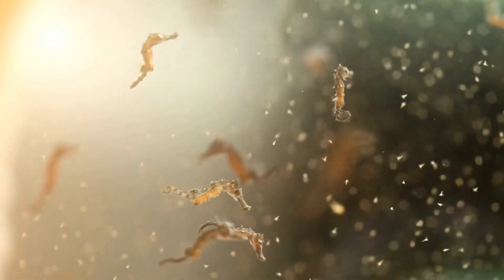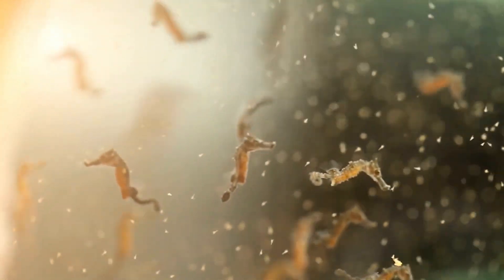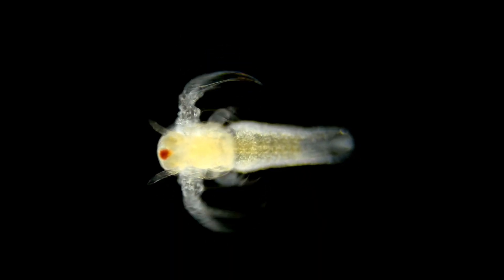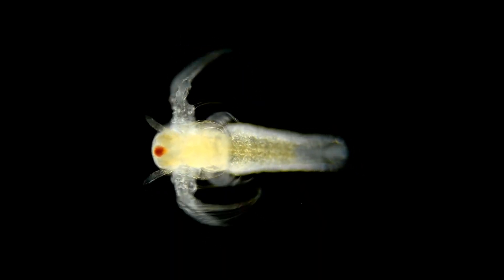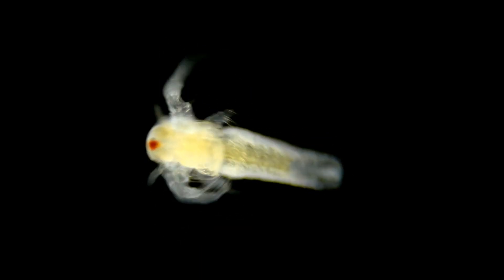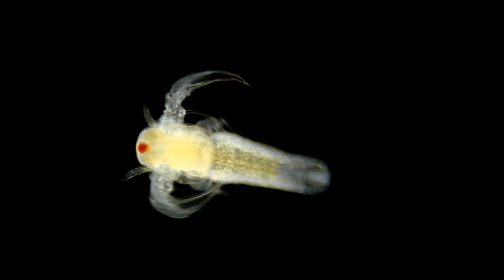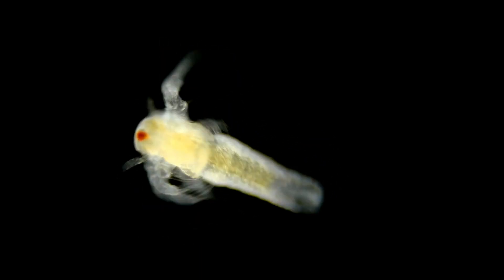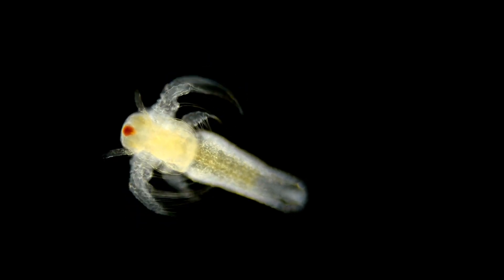Brine Shrimp are small crustaceans that have similar metabolic processes to higher organisms, making them a good indicator of potential toxicity in humans.